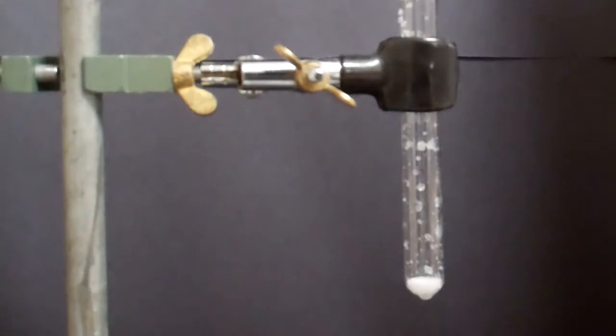In this next test, this is for the chloride anion. I've already got my chloride substance in the test tube.